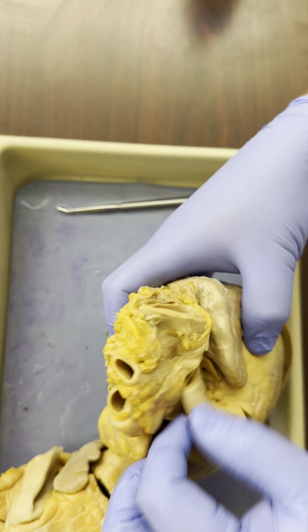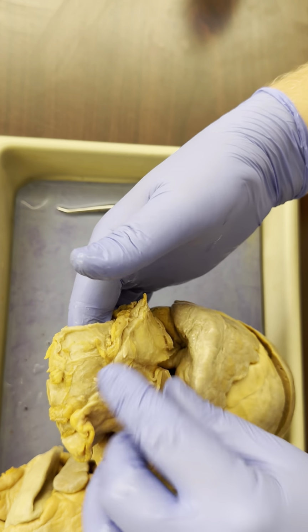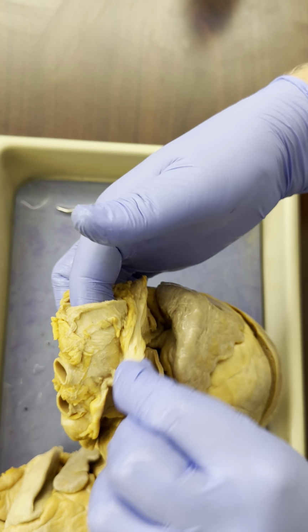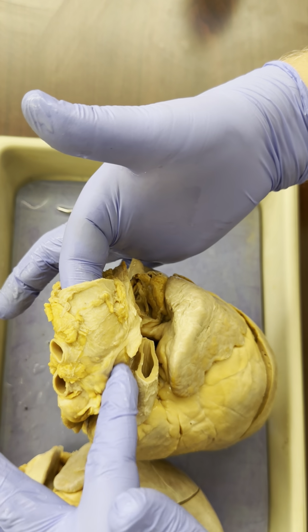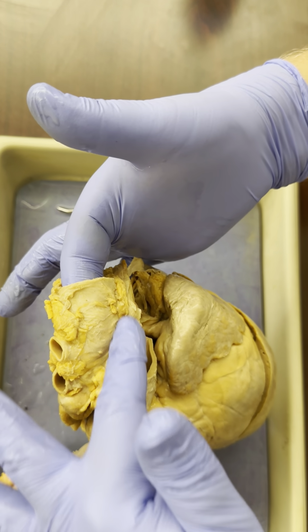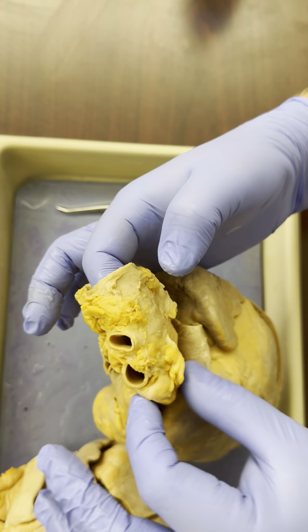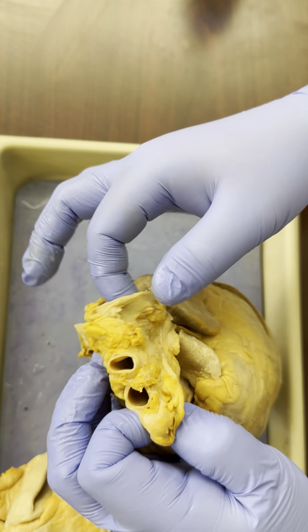Now, up at the top of the heart, this one, there's a lot more here than you need to know. There's a little bit of pericardium and other connective tissue here, but right behind the pulmonary trunk, the largest vessel in the body, this is the aorta. And we can see some vessels coming off of the aorta. On the real heart, we do not need to know those.